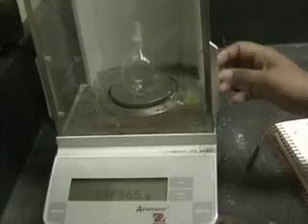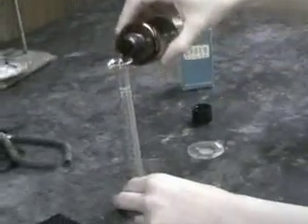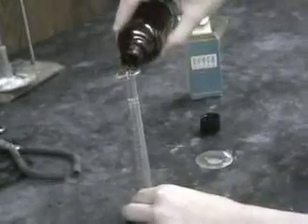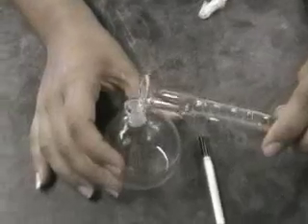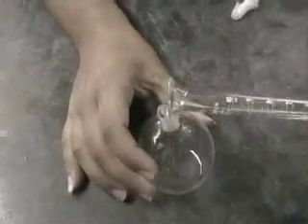First, we find the mass of the flask before the volatile liquid is put in. We take a sample of the unknown volatile liquid, whose volume when it turns to a gas we know is larger than the flask. We pour our liquid into our flask.